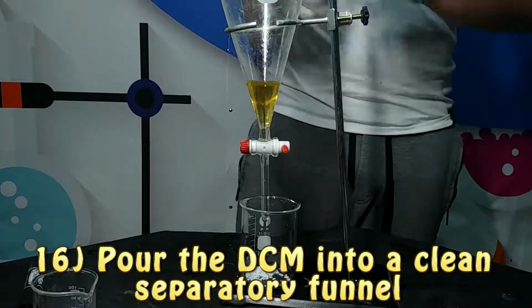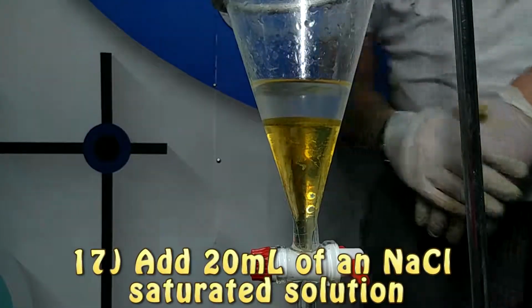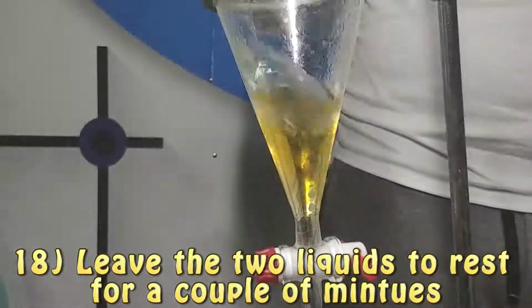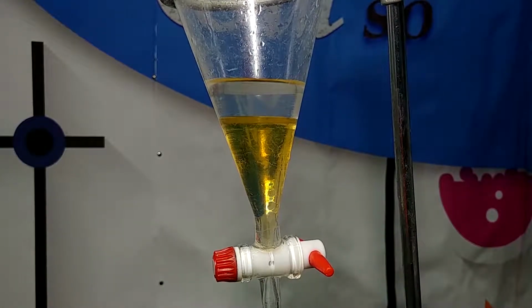After that, we're going to prepare a saturated solution of sodium chloride and pour it into our separatory funnel with the DCM. Then we are going to leave the two solutions to rest for a bit, and we're going to drain only the DCM into a beaker containing calcium chloride.